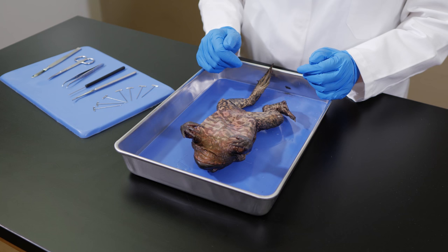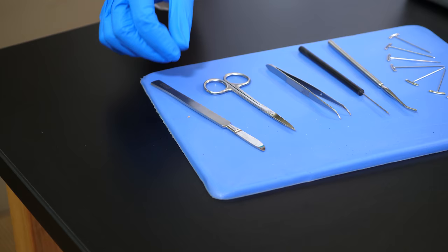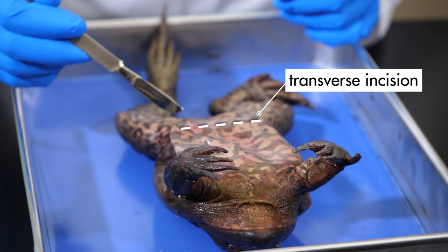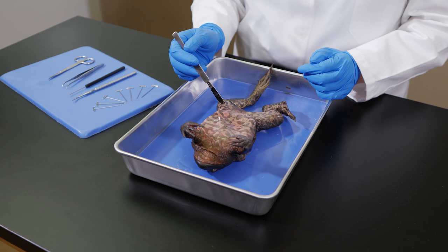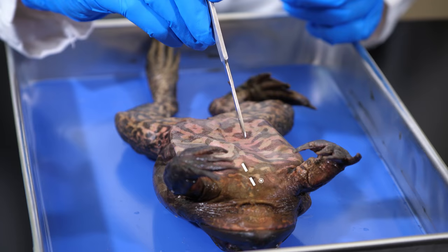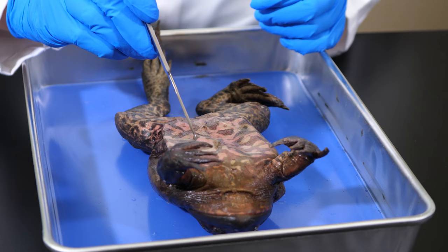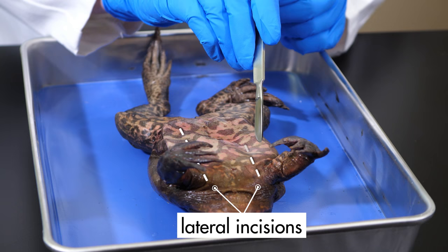A cut to the tissues of the specimen is called an incision. Incisions may be made with either a scalpel or the scissors. An incision across the specimen at right angles to the axis is a transverse incision. An incision that follows the axis of the specimen is a medial incision. An incision that runs parallel to the axis is a lateral incision.